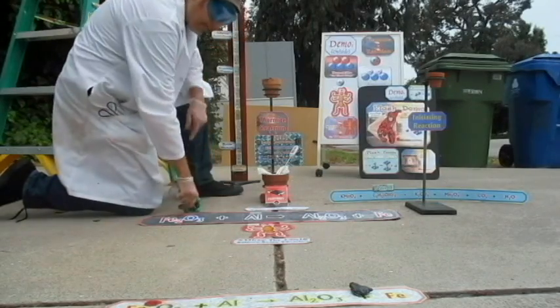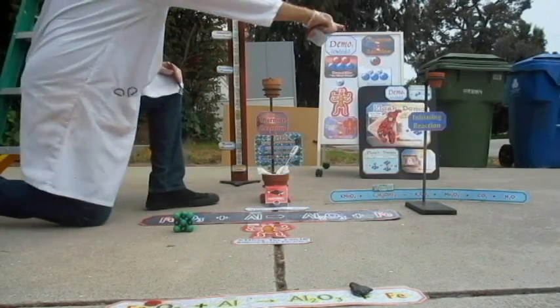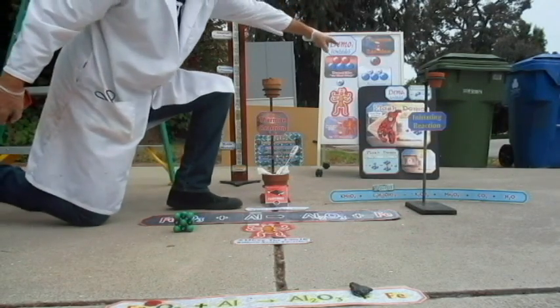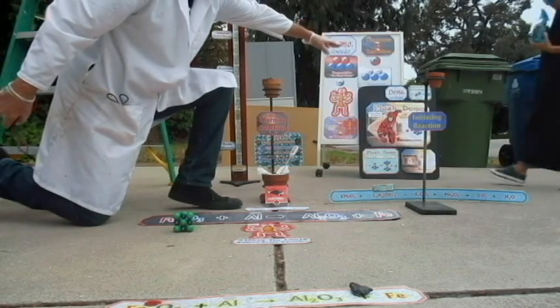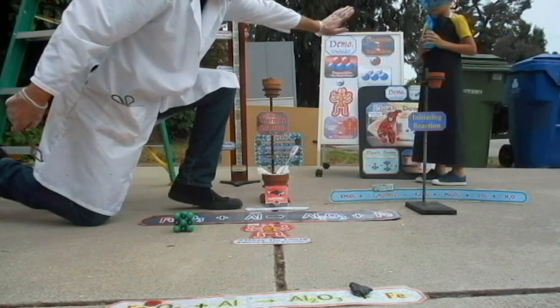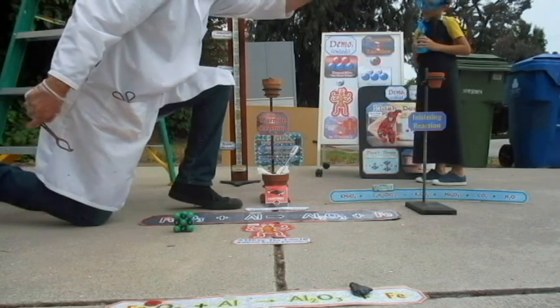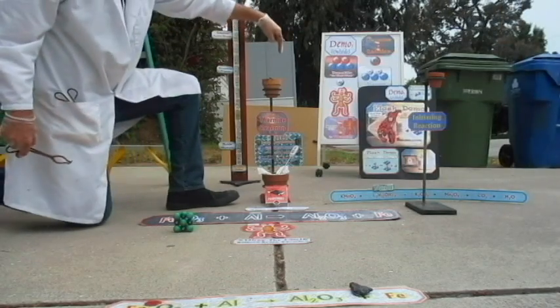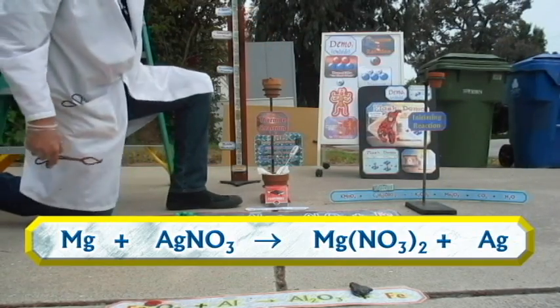All it's going to take is a drop to get this one going, and then when this one goes, Ian, wait, come over here, Ian, so you're back there, and show the squirt bottle. Stand back there. Don't squirt. Stand over there so you're in the camera. Ian's going to squirt with the squirt bottle, not from here, not from here. Not right now. Okay, you're going to squirt it. Now go back. And his little drop of water that's going to land in here is going to start off the flash demo. It's going to be flashy, really quick.